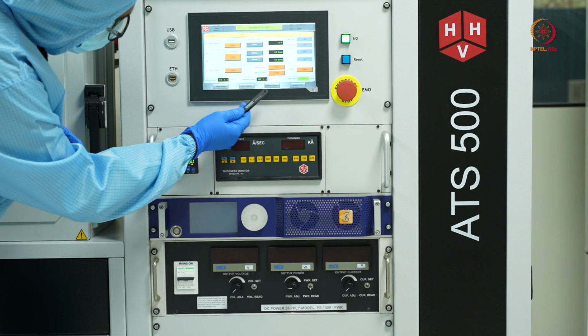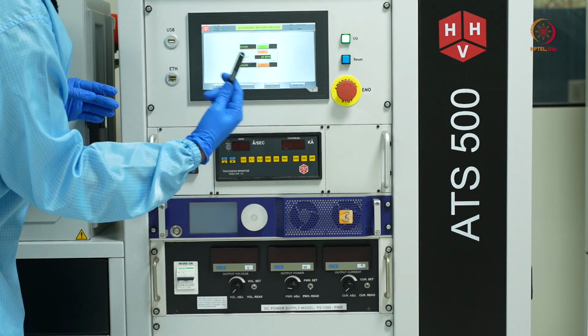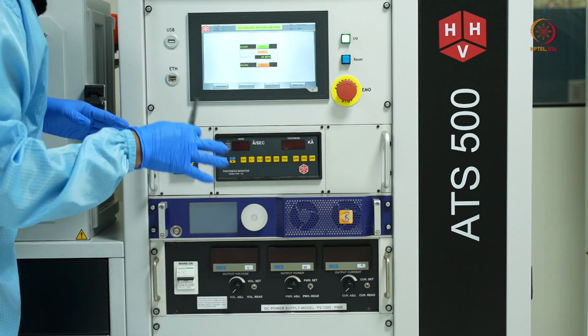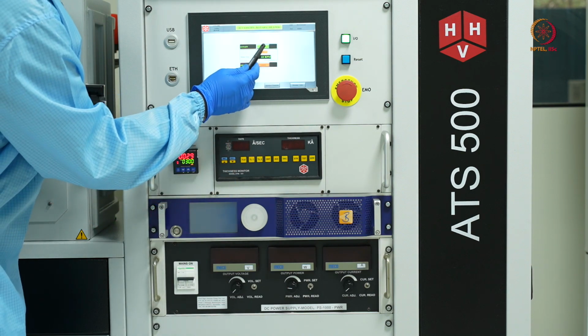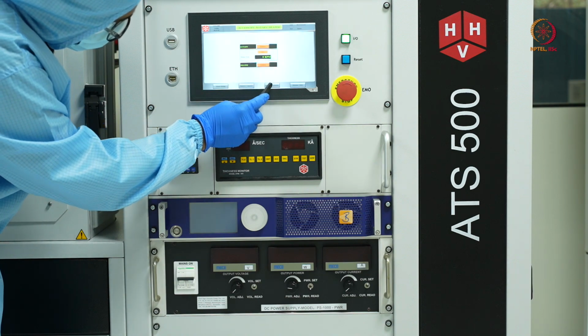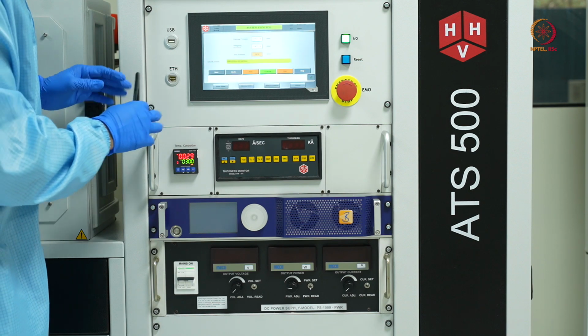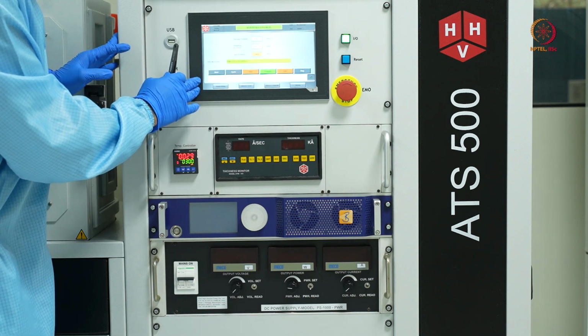So what I'll do, I forgot to mention, we also had the rotary drive in motion at 10 RPM. I'll disable the rotation and go to system control. And now you can see the pumping is still going on.